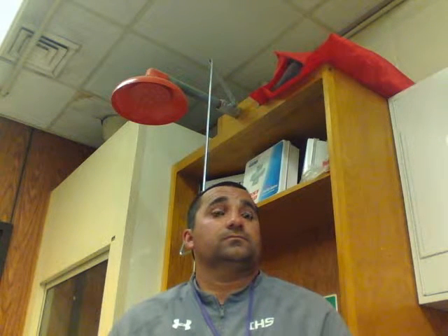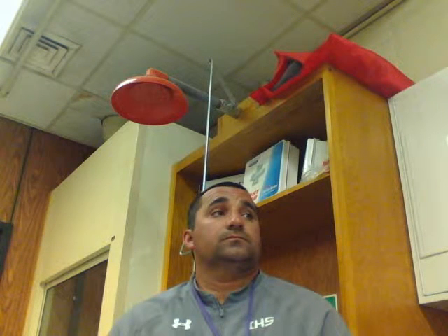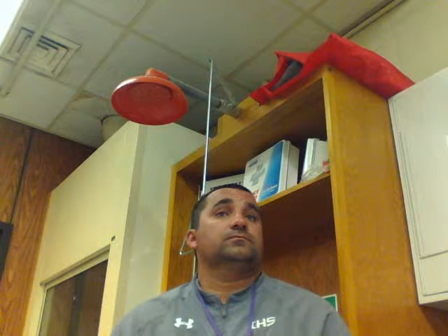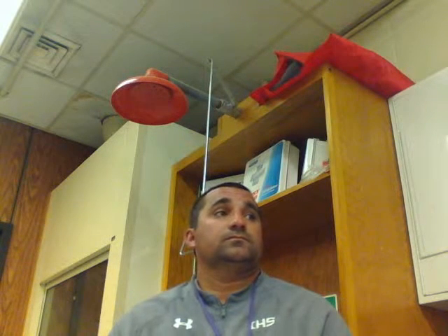No, that's another title. I don't even need to use it. Ocular is the eyepiece.